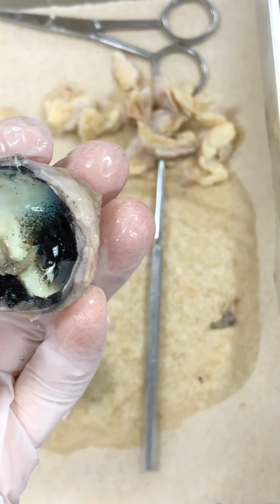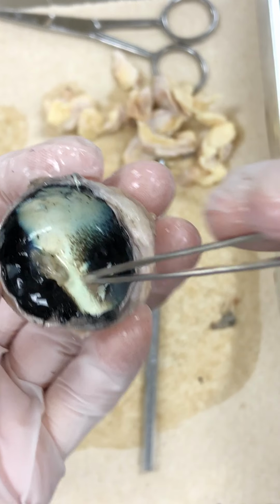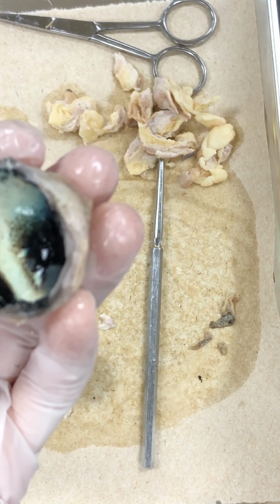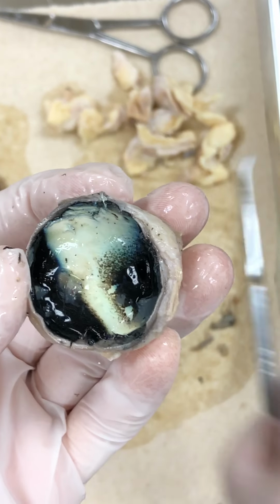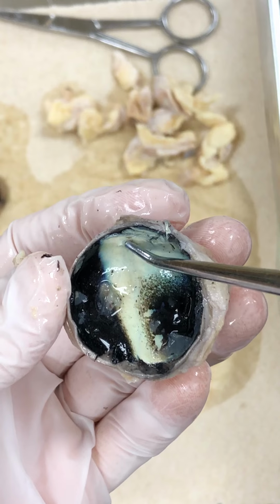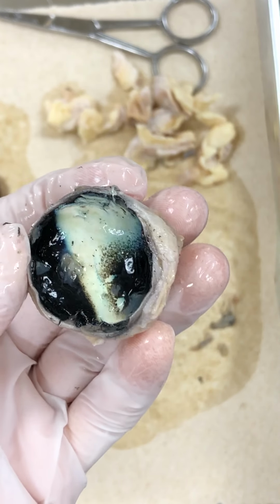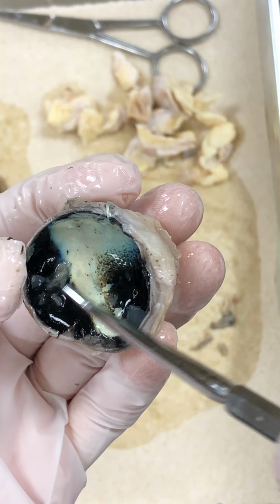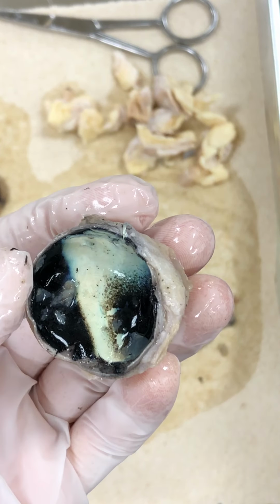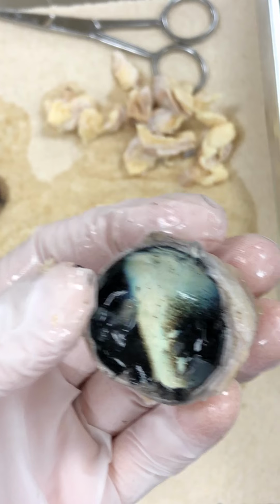we can get that out. Then we can just see the choroid, that middle layer. In the choroid, as you can see, it has a very shimmery, kind of iridescent look to it. We don't have that. Okay, this very iridescent, shimmery, real pretty looking. And in a lot of these sheep, it's more of a greenish blue. This one's more yellow. Anyway, that's what's going to give them night vision.